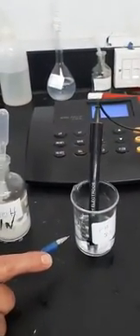I will take another 20 ml of acetate buffer at pH 3.3 and put it in the beaker. This is the pH before addition. On this solution I will add a strong base like NaOH — 1, 2, 3, 4, 5, 6, 7, 8, 9, 10, 11, 12 drops. Now I will measure the pH after addition of this strong base. It is expected to increase. As seen on the device, it is 3.76. I will record it: 3.76.